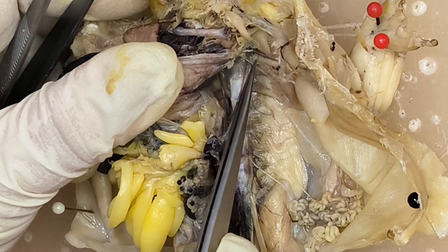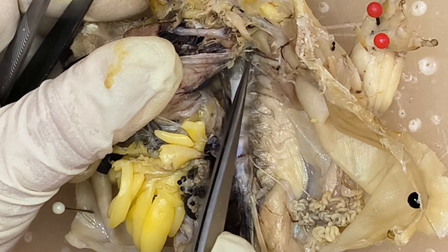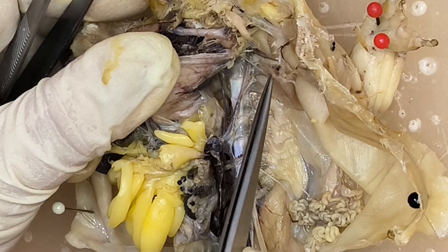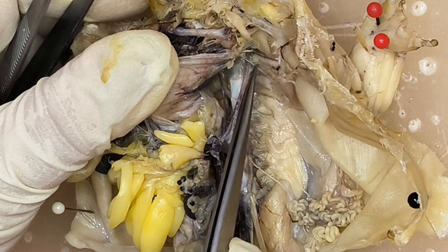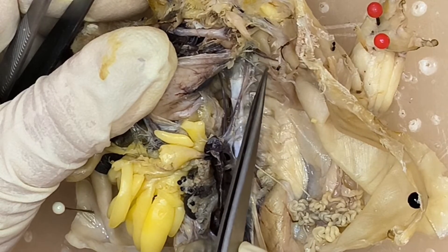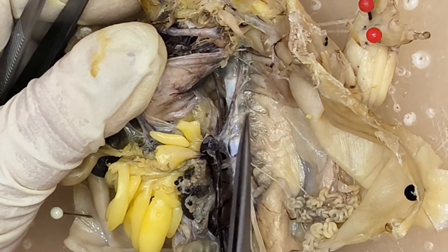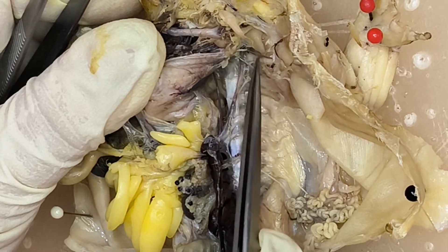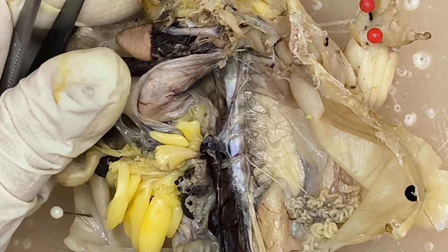You cannot miss the second one — it's very large. This is the brachial nerve, innervating the arm. And then this is the third, which innervates the shoulder and the arm. Together, they form the brachial plexus innervating the shoulder and the arm.